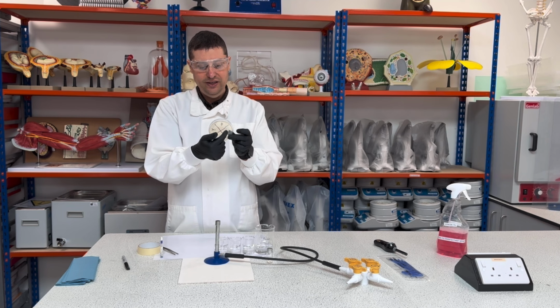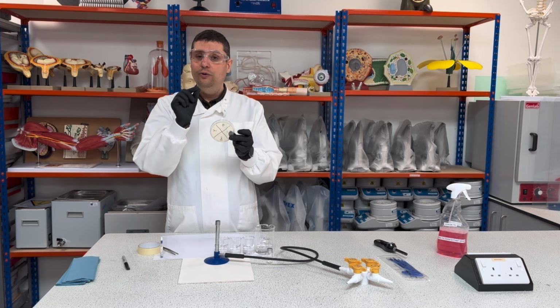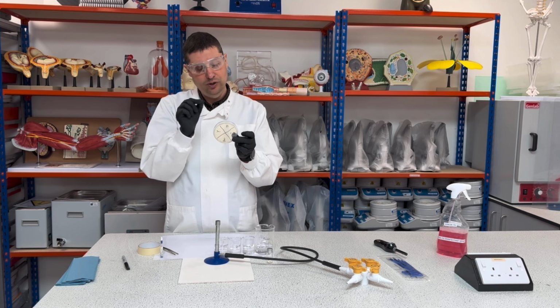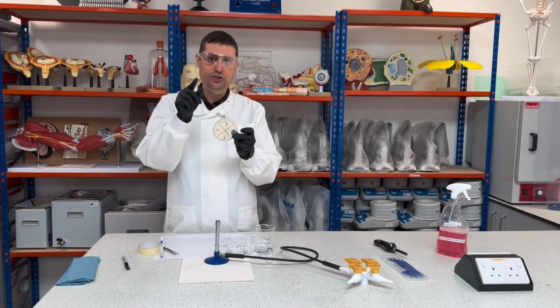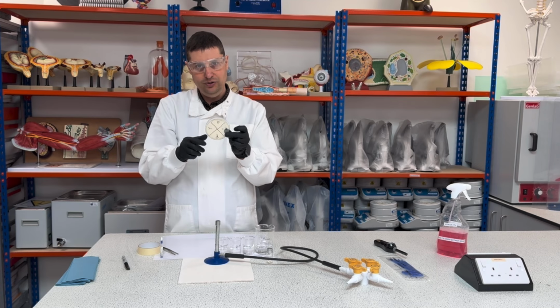So it should be in the middle of the area, so it's far enough so you know the ring around will be for one specific bacteria, for one specific substance, or far enough from the edge so you will be able to see the whole ring forming around, okay?